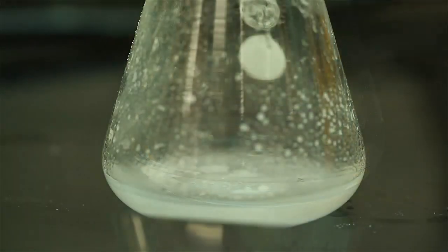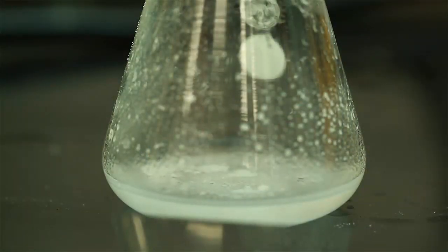If you're unsuccessful with the scratching method, then you may have too much solvent. If this is the case, simply reduce the volume by boiling away the solvent in the fume hood.